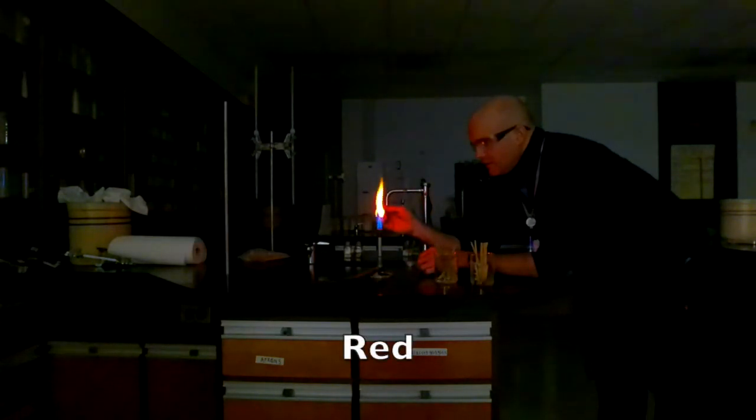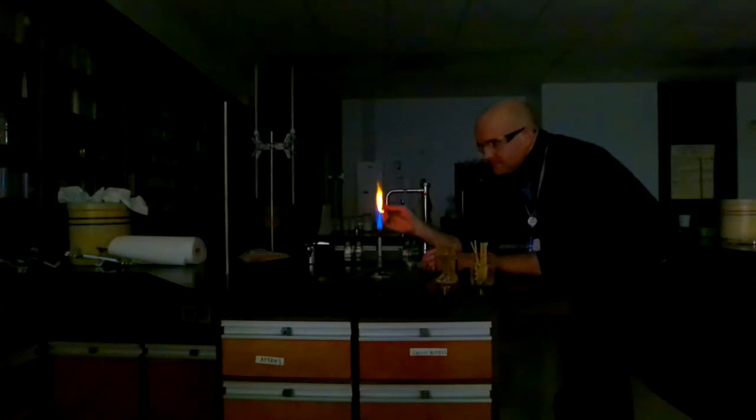Alright, let's do strontium nitrate. Strontium nitrate is my favorite. So hopefully you saw a nice red flame. That's exactly how they get red fireworks, is they use strontium nitrate.